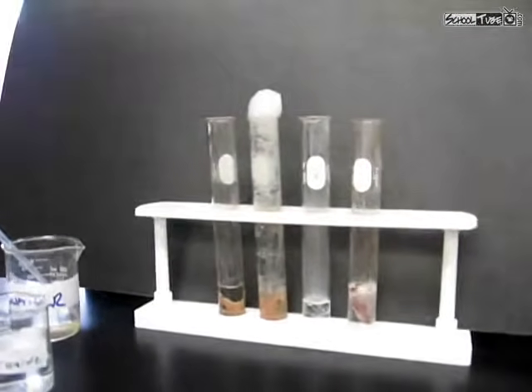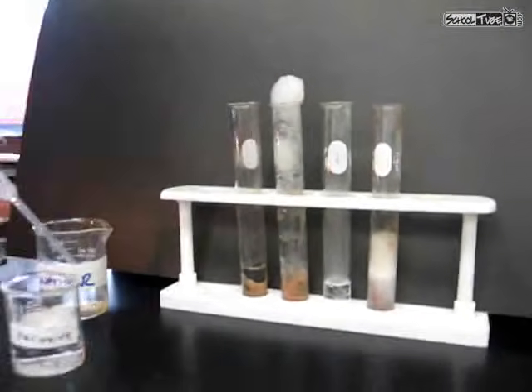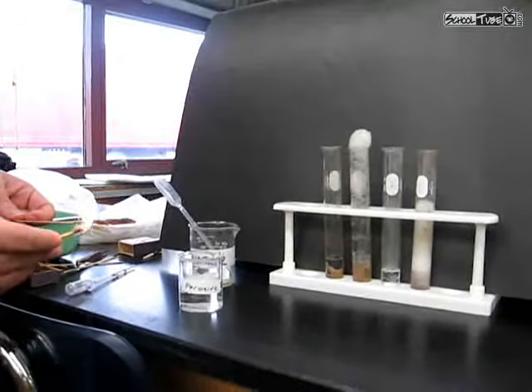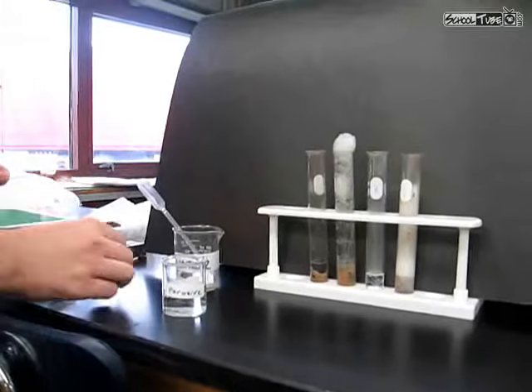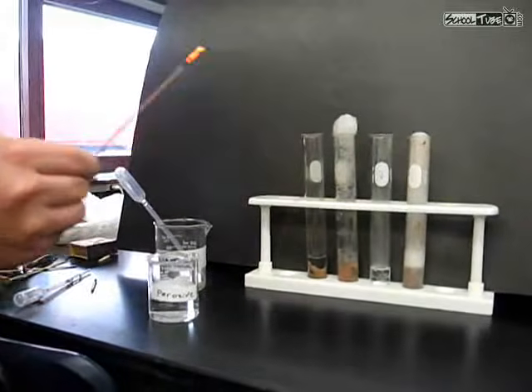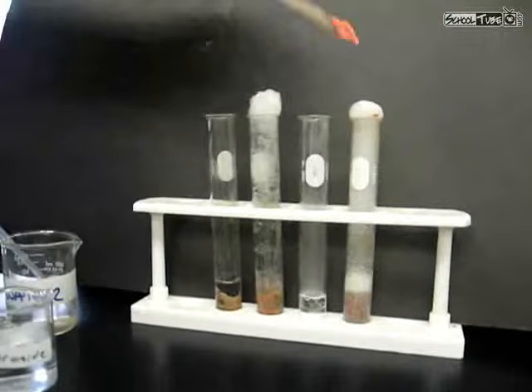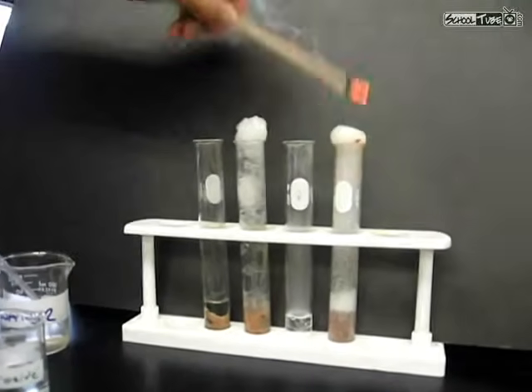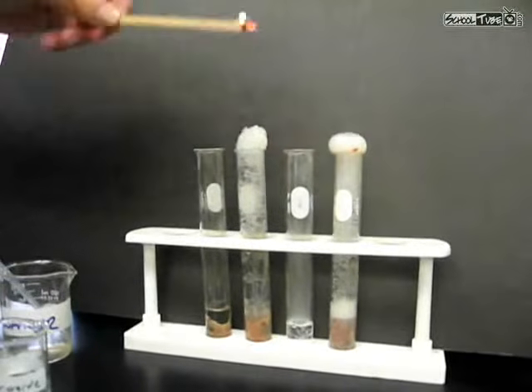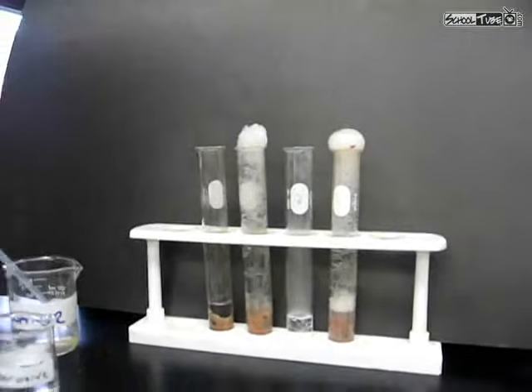And of course the same reaction is occurring again, only this time we're going to actually prove that oxygen is what's being made. I don't know if you know this, but pure oxygen in the presence of a spark creates a fire. So I'm going to do the same technique again. We're going to let that burn for a little bit. So now it's glowing. Oh! Oh, and we burned it out, so we'll light it again.